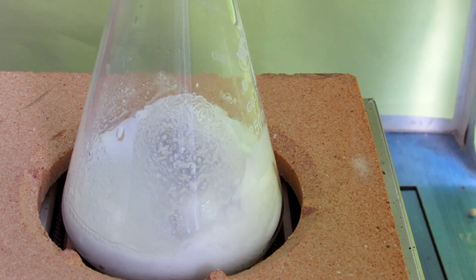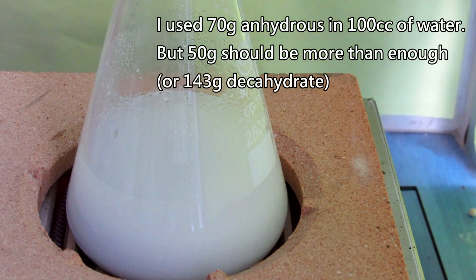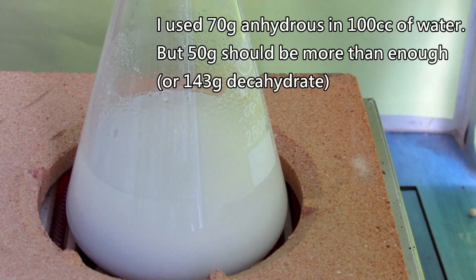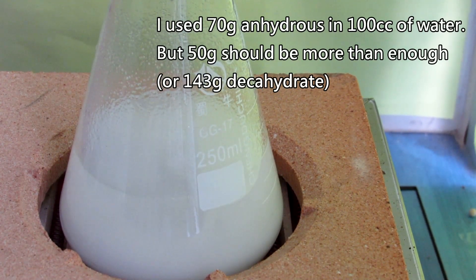Then, dissolve some sodium carbonate in water in another beaker. The quantity is not very important, but I think I used about 70 grams of anhydrous sodium carbonate in total.